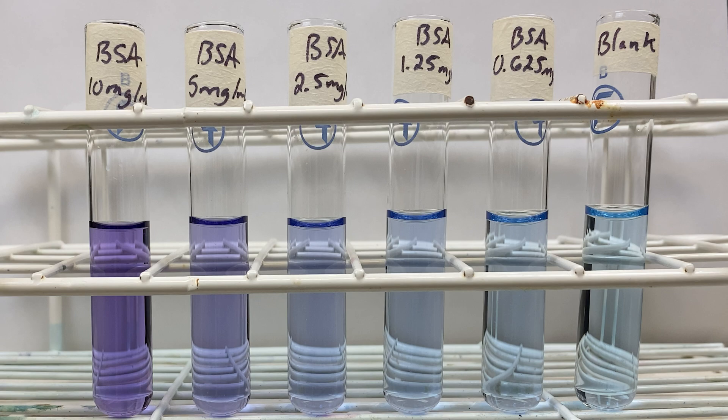We're going to use a Biuret test as it binds to the proteins or peptides and changes color. As you can see, the blank shows that Biuret itself is blue without any proteins or peptides in solution.